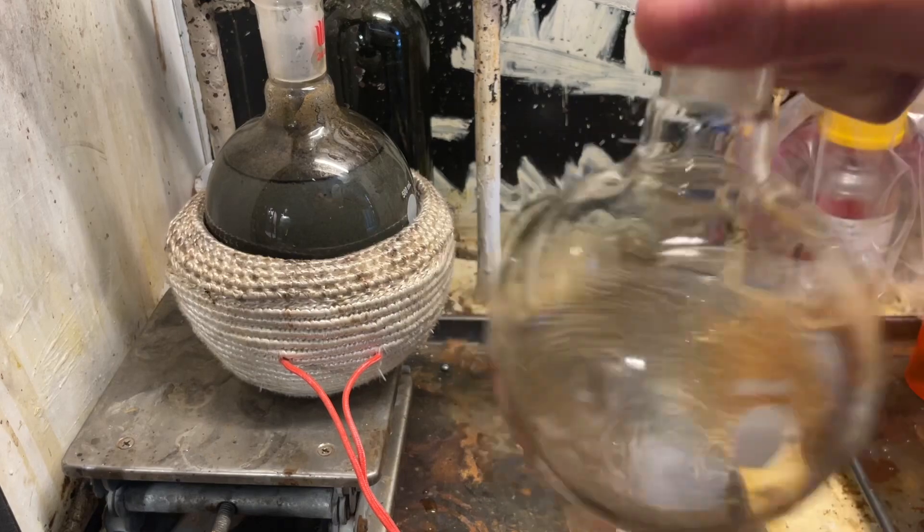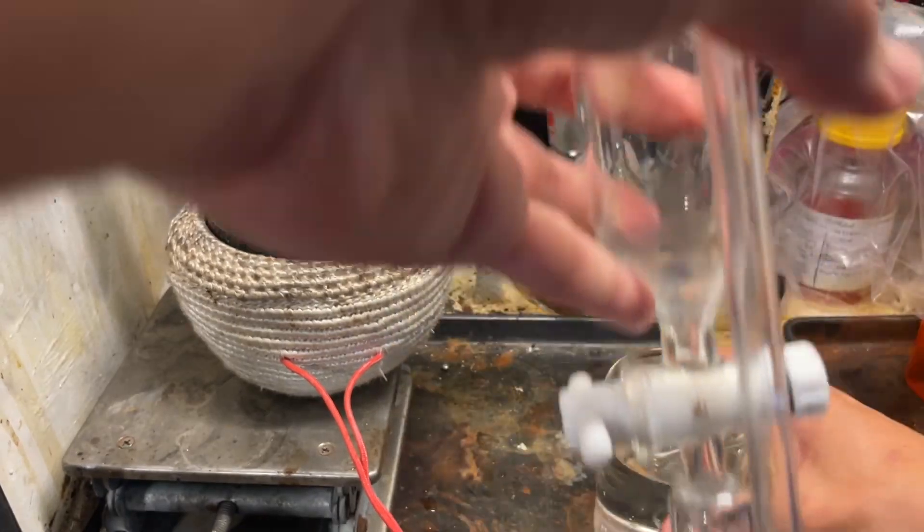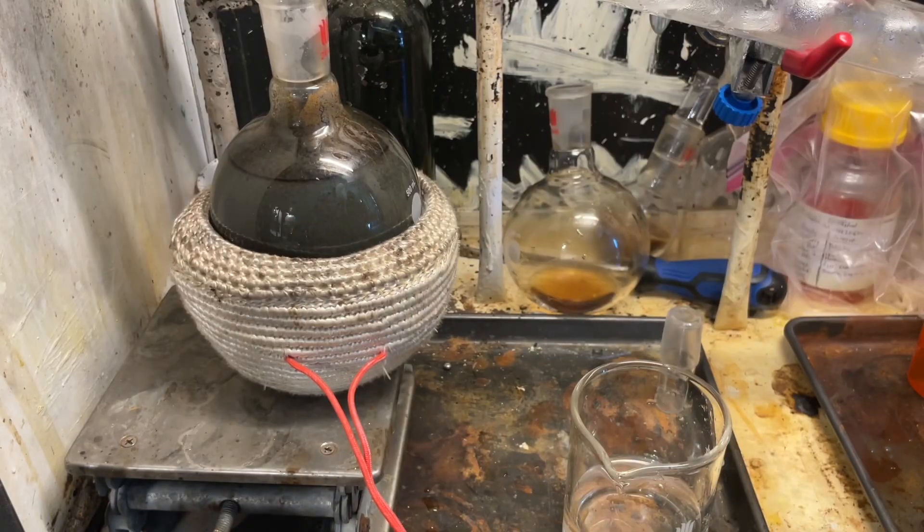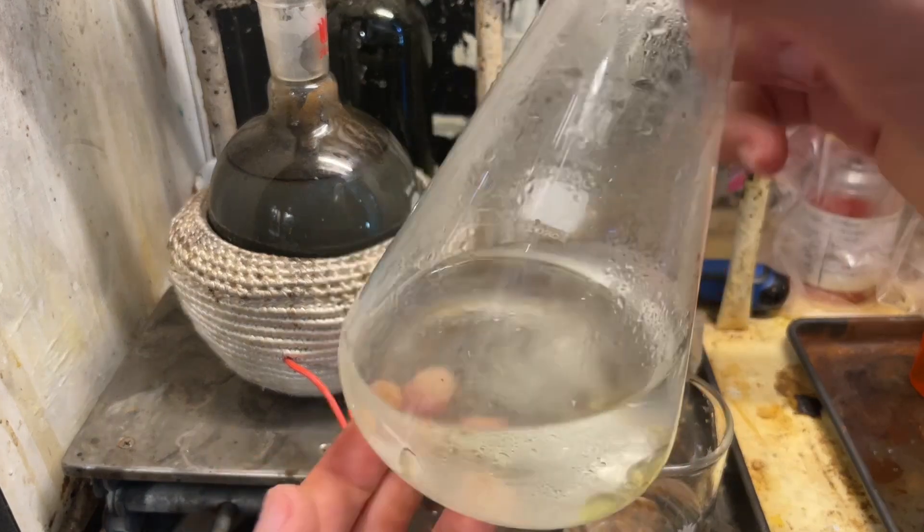The tar seems to dissolve in acetone, so that's how you're going to clean your glassware — with some hot acetone. This is cold, I'll heat it up later on a steam bath. And I'm going to steam this with the ice bath water because we're going to conserve water today. We're going to recycle our nitrobenzene, and you can see there's quite a lot in there.